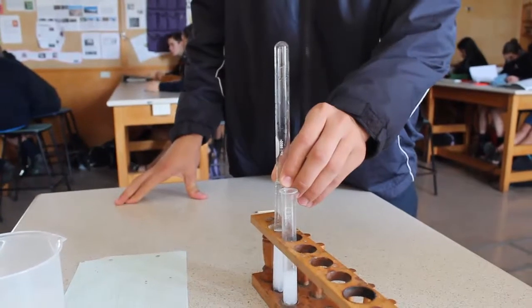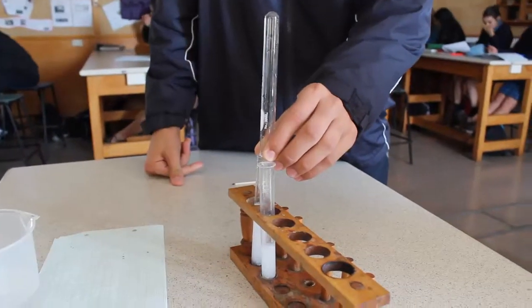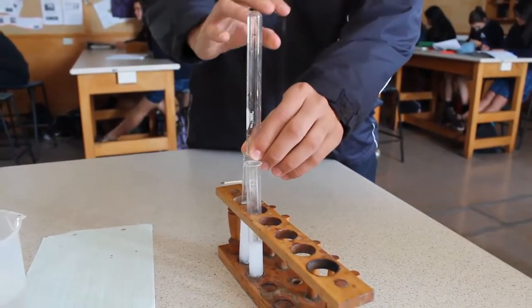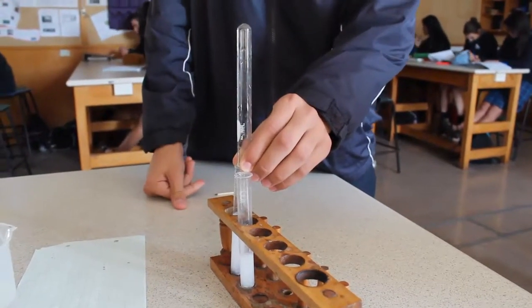Okay, ready? Go. Now, we hope that there's enough hydrogen gas in there, and then we'll light a match. The match will combust with the hydrogen and it should create a popping noise.